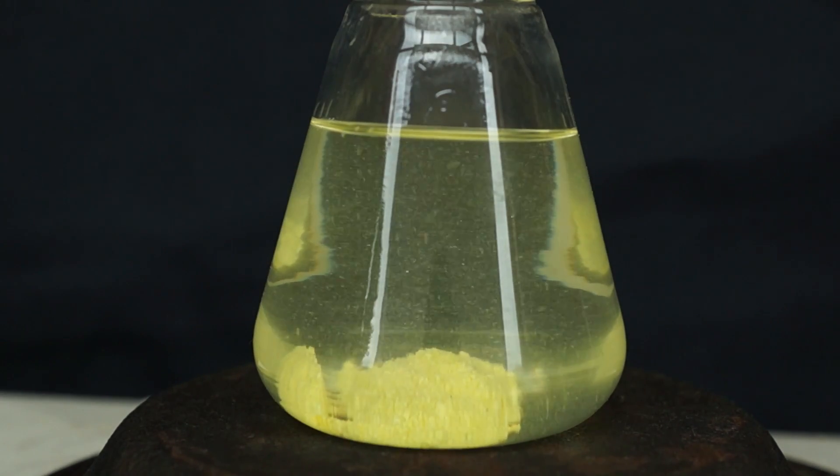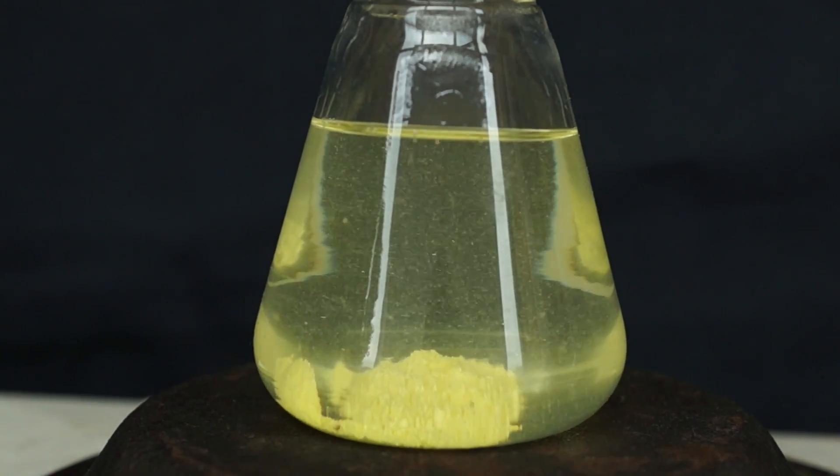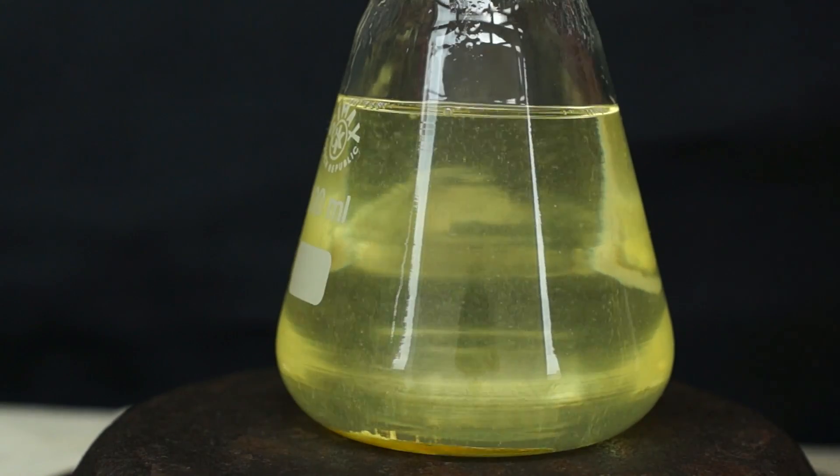When it's heated, our sulfur starts to dissolve in toluene. Also, I have to tell you that this experiment should only be done outdoors or inside a fume hood.